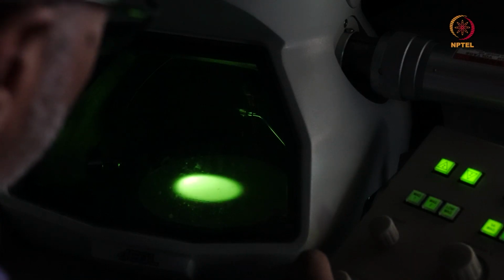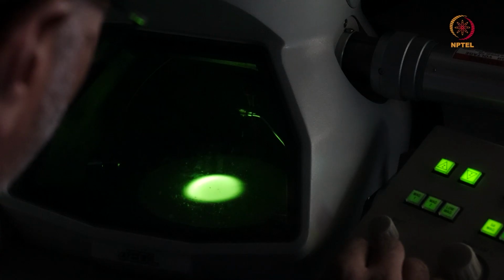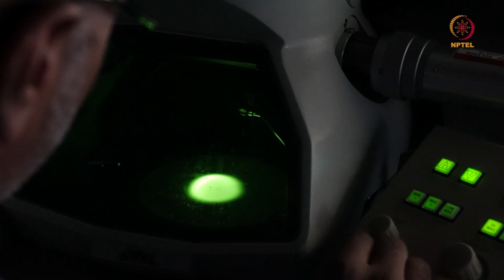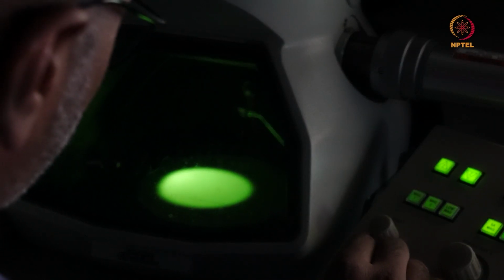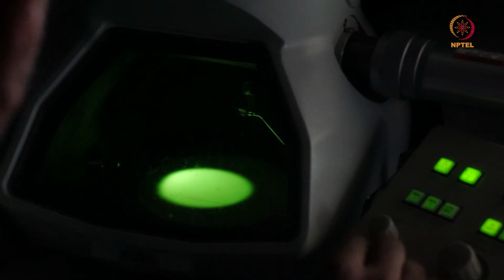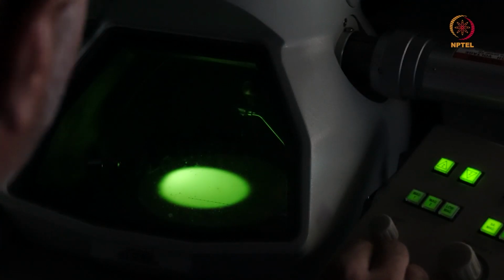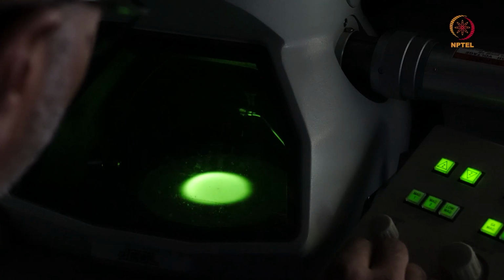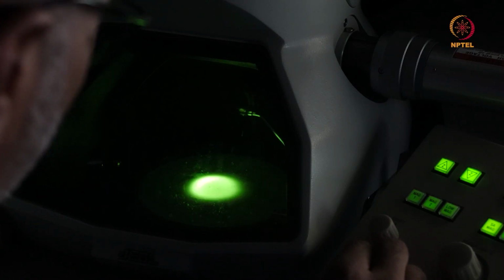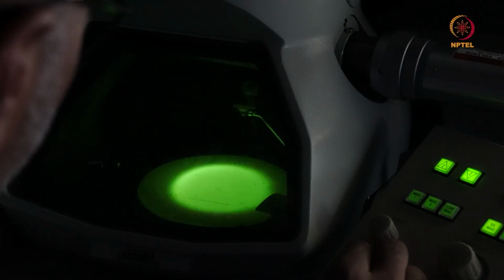You can say this is more or less corrected, because this is a slightly older filament and the coherency is not as good as a new lanthanum hexaboride filament. You'd be mostly spending a lot of time trying to correct this, but it won't go beyond this on a lanthanum hexaboride system. So I would say this is sort of corrected.